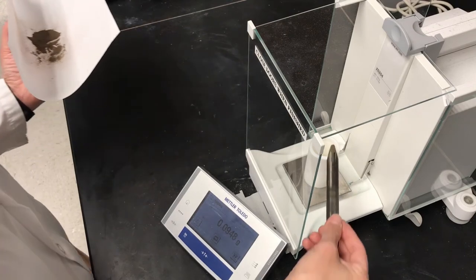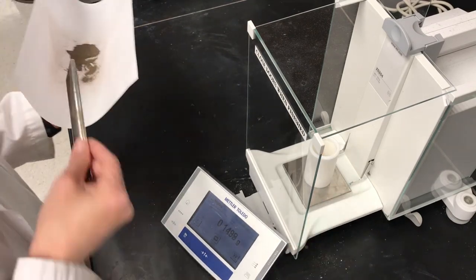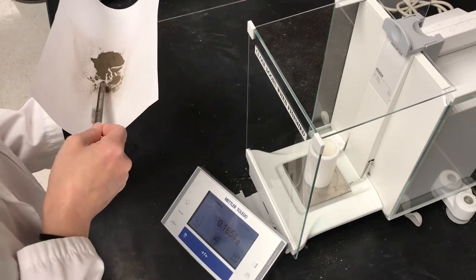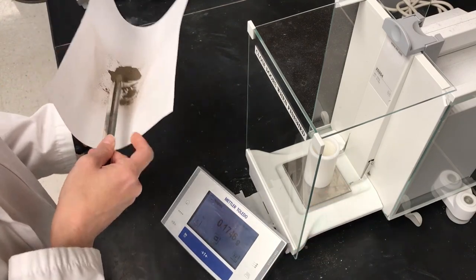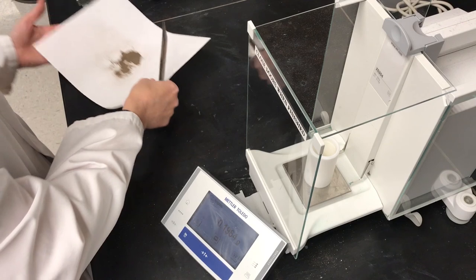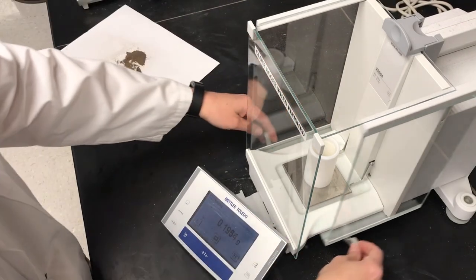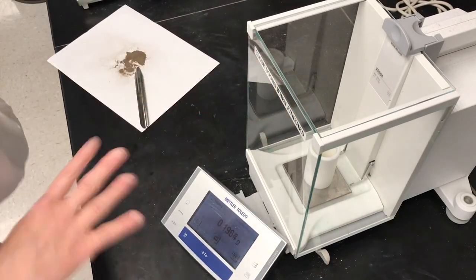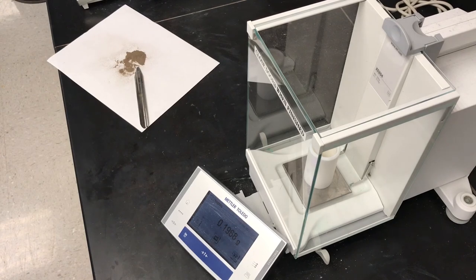So, that's where our 0.2 is coming in. There we go. So, now let's really weigh this. We want to know the exact mass of this sample.